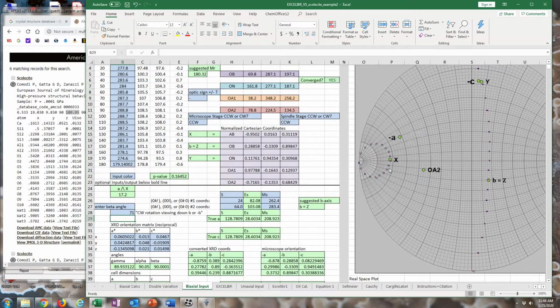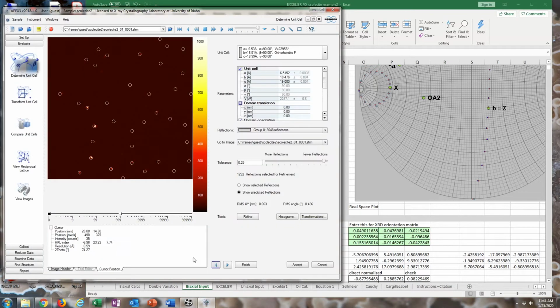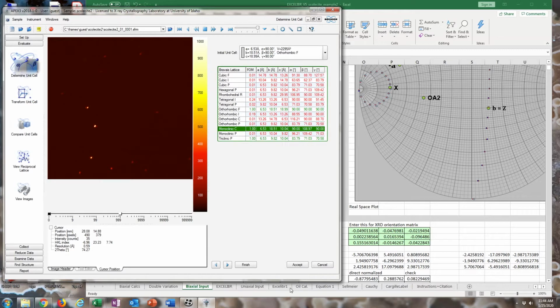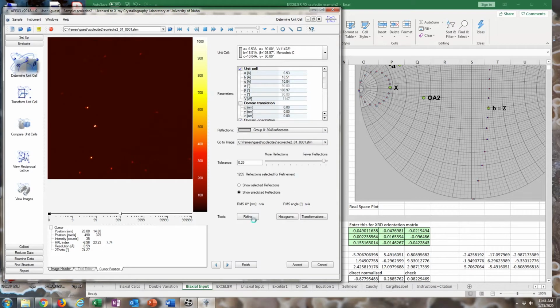This plot will only project upper hemisphere axes. Beta here between A and C would be acute because it's performing the rotation clockwise, but technically the C axis would be in the lower hemisphere, so that A was positive A, B was positive B, and C was positive C. Going back to this monoclinic setting so that at least it will try to find a monoclinic C setting. Click Refine. Refine that a little bit.